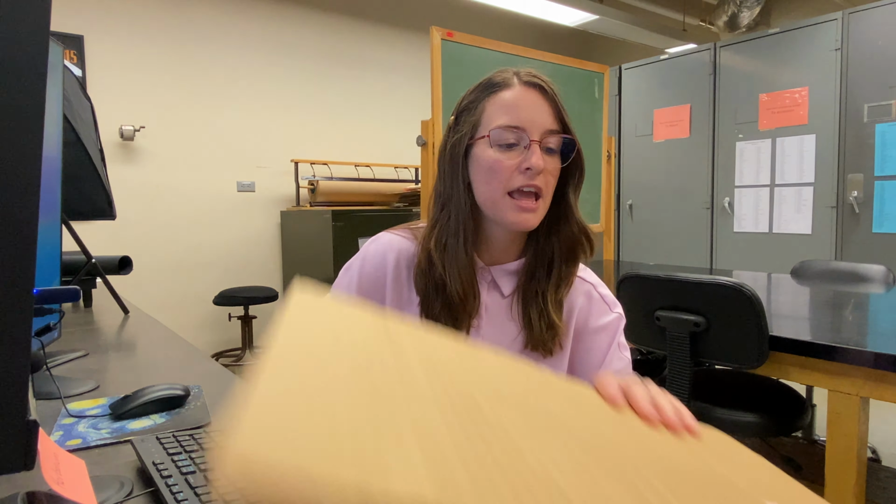If you encounter a specimen that is too difficult for you to interpret, then you can put it back in the cabinet from which you got it and put it onto the corrugate that says database problems, and then consult the curator later about the problems that you're encountering.